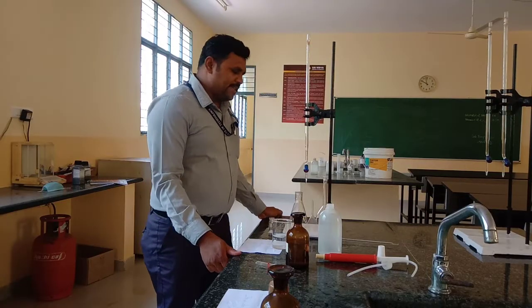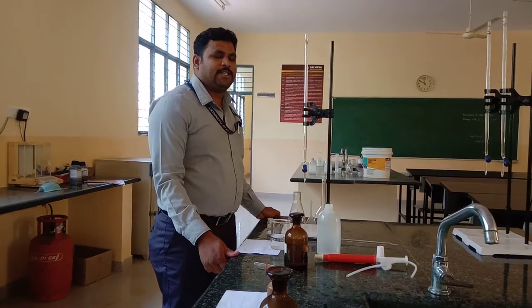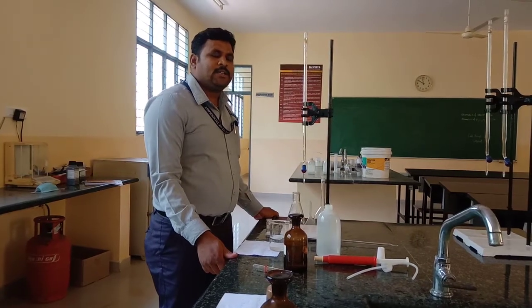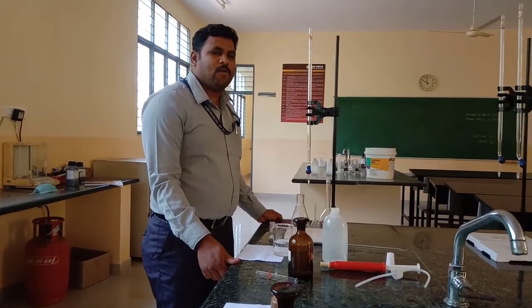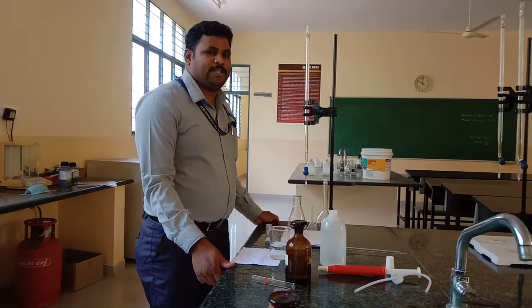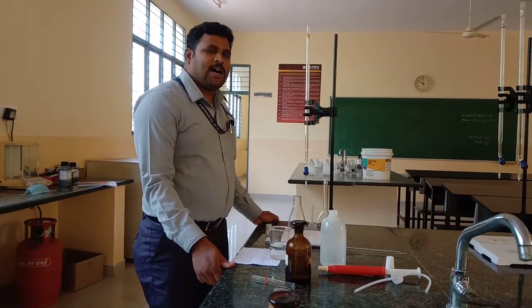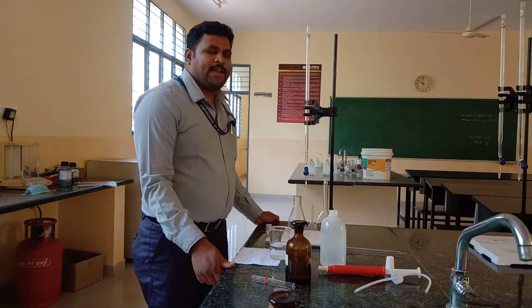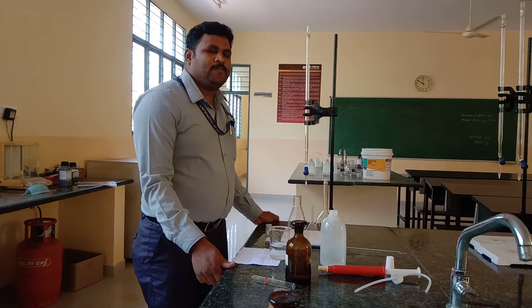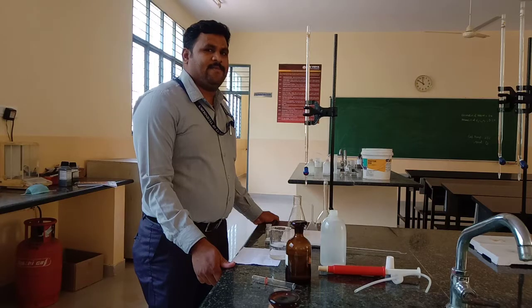Before going to perform this experiment, we should know what is meant by hard water. Hard water is water which does not give lather or foam easily with soap. Hard water is caused due to the bicarbonates of calcium and magnesium, and also chlorides and sulfates of calcium and magnesium ions.